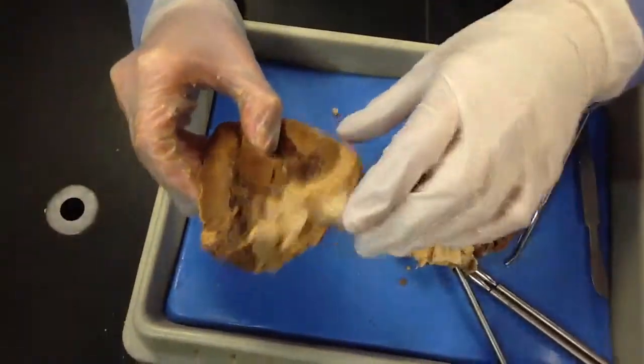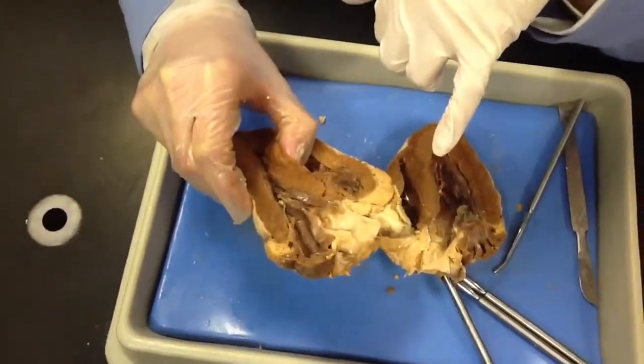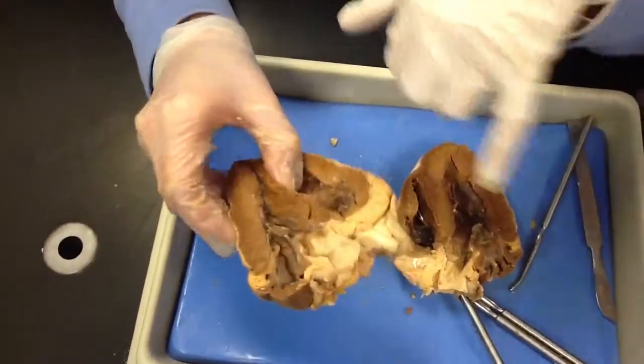It's just where like your SA node is. So you should have everything up there. But yeah, you should have your pectinate. It has it listed. Okay, good.